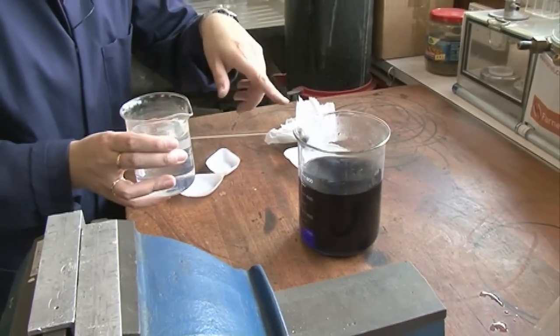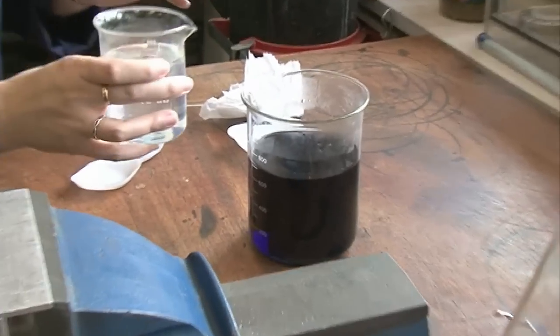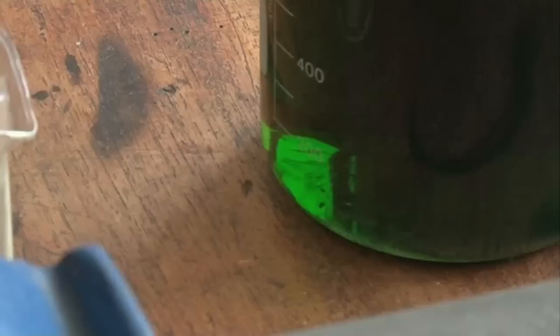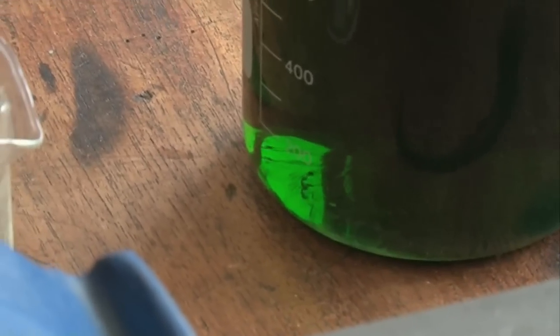We'll combine the two and you can watch what happens. First of all it starts out blue. We pour this in and it instantly goes green. You've got a nice green color which won't stick around for long.